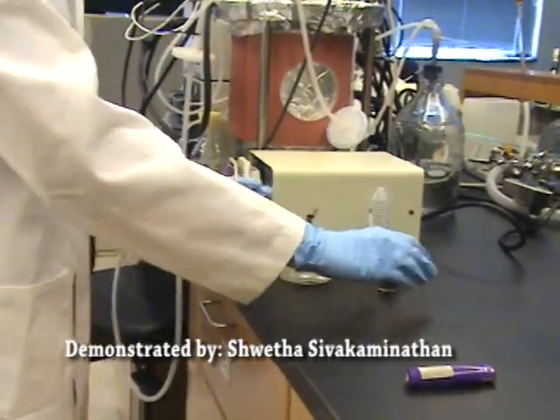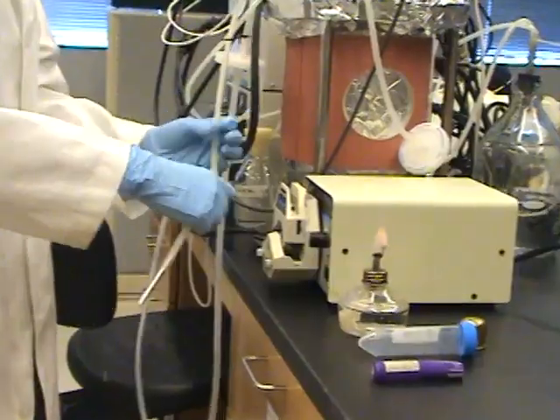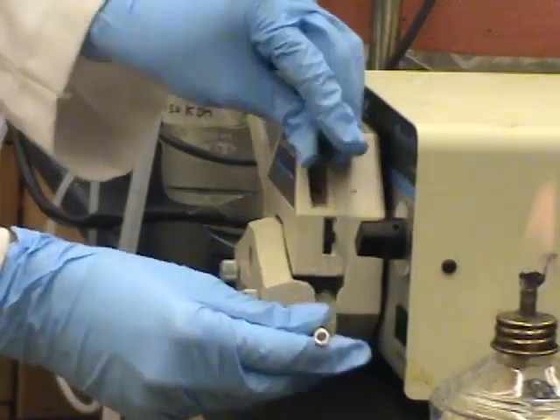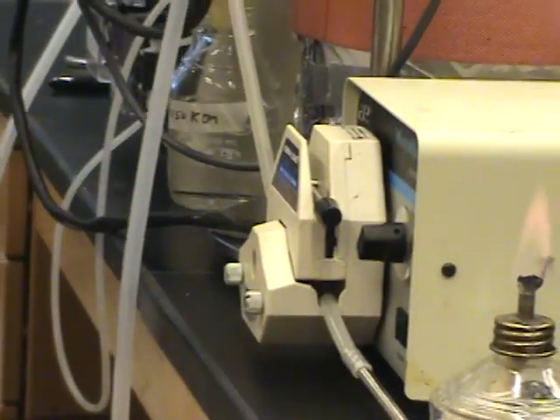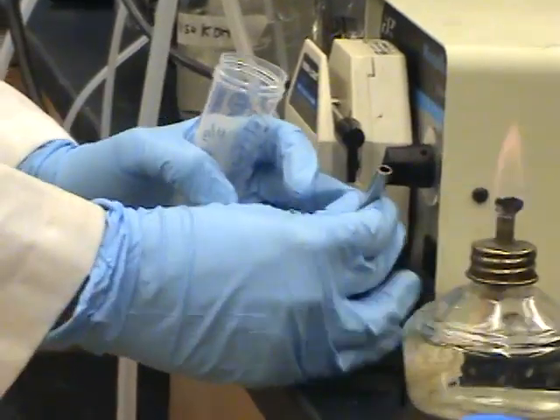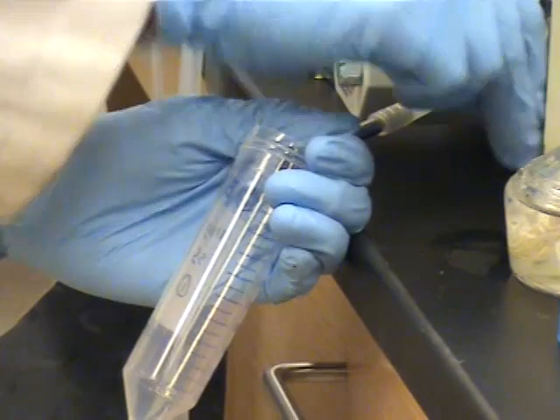Light the flame to reduce contamination. Attach a sampling tube to the pump and release the restriction valve. Flame the tip of the sampling tube. Turn on the pump and begin collecting.